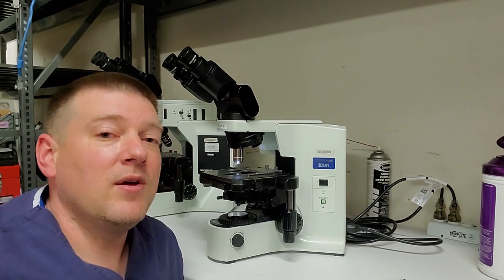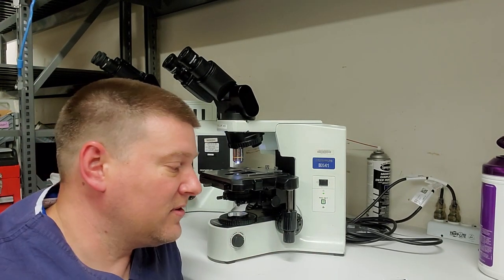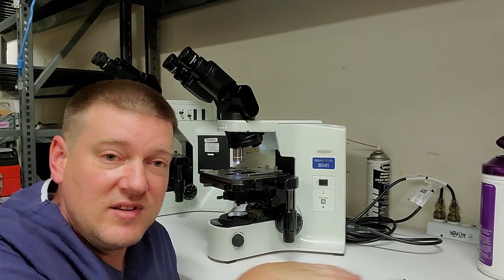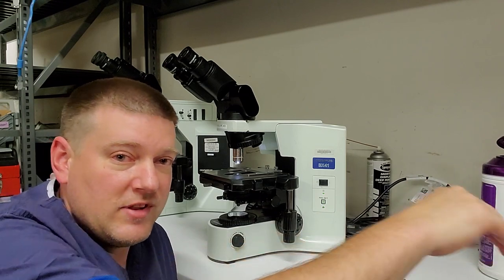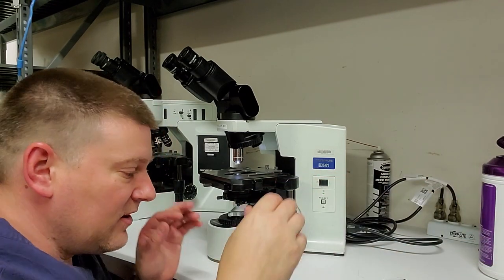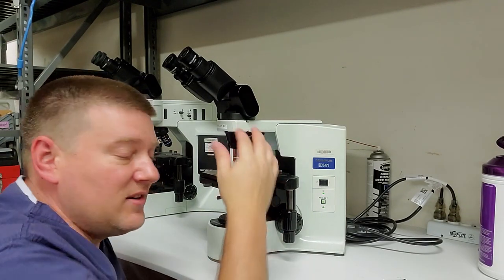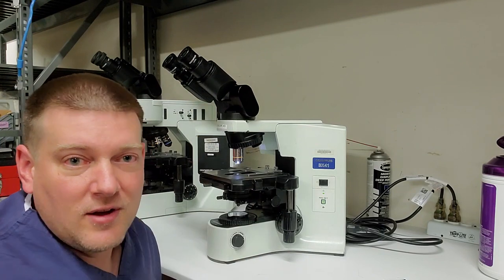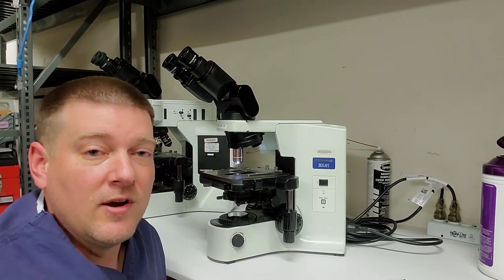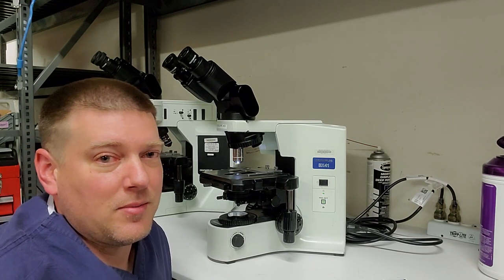Take your time. Whenever you get dirty, you clean your hands by changing out your gloves, and don't leave greasy, contaminated stuff near where you're doing your PM. I place my stuff way over there, out of my way, because if you set a contaminated object on your table, you're going to touch it and then you're going to touch something else, and now you have a cross-contamination of some sort of debris, oil, whatever. And there goes the next 2 hours of your life trying to clean that microscope.